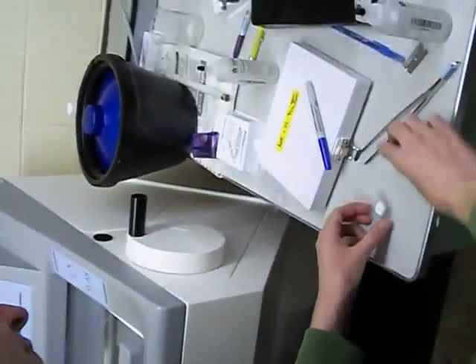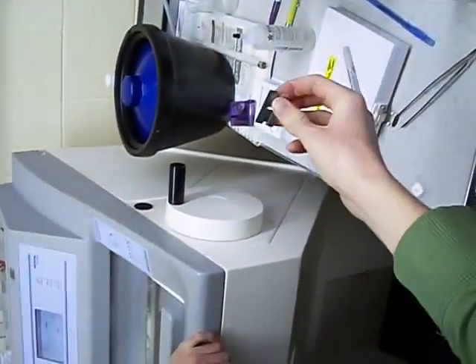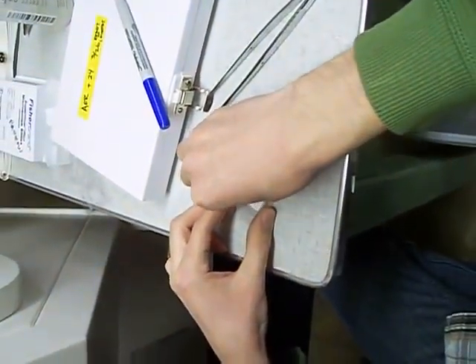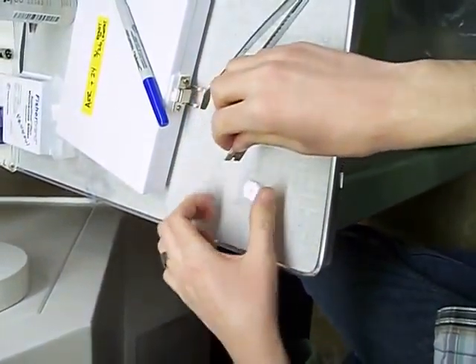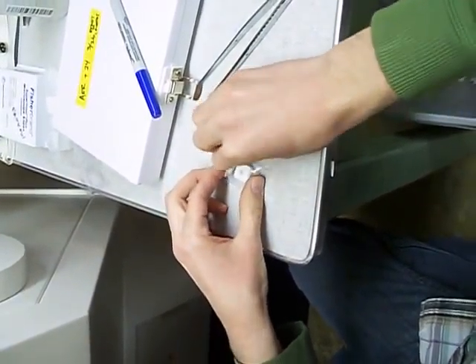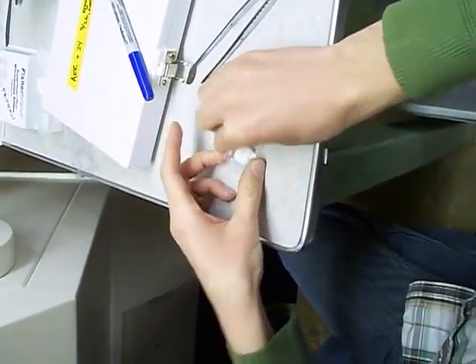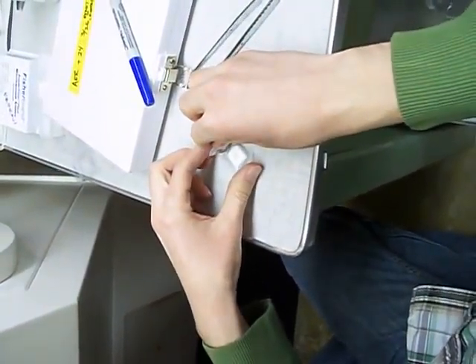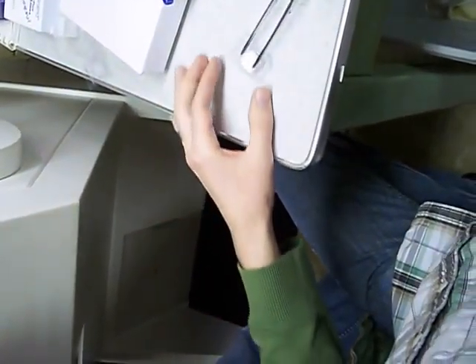So after it's frozen, you can see the little dot is still there. You take a razor blade and you just want to cut along the plastic on the side of the gelatin — just cut straight through the mold. When I get to my tissue, the mold's not worth saving. And just cut it on all four sides until it comes loose. You want to touch it with your hands as little as possible.